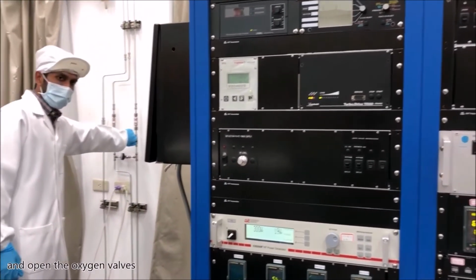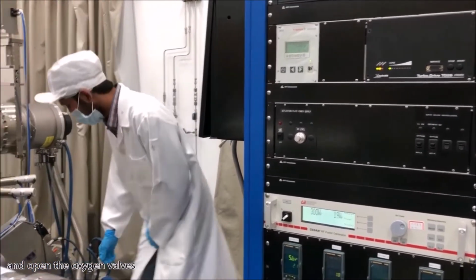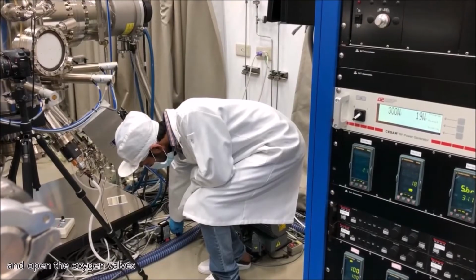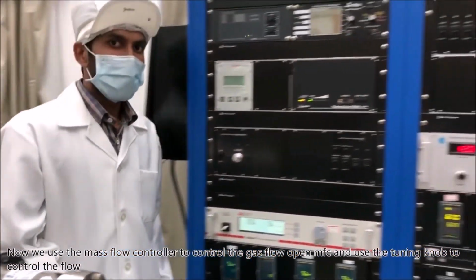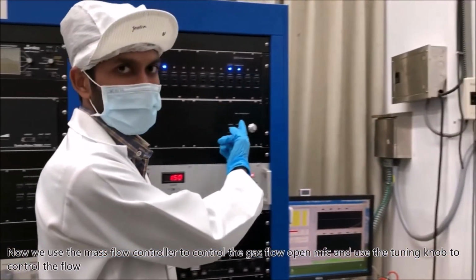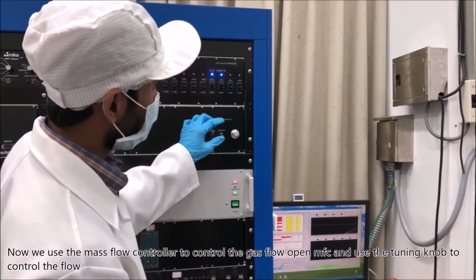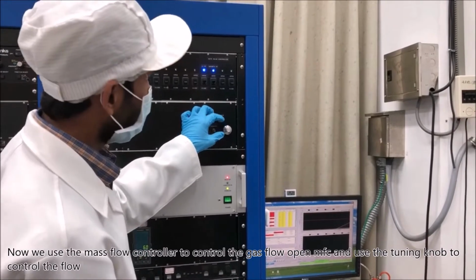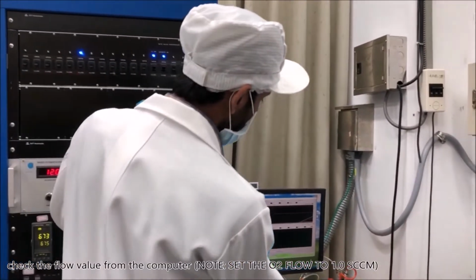And open the oxygen valves. Now we use the mass flow controller to control the gas flow. Open MFC and use the tuning knob to control the flow. Check the flow from the computer.